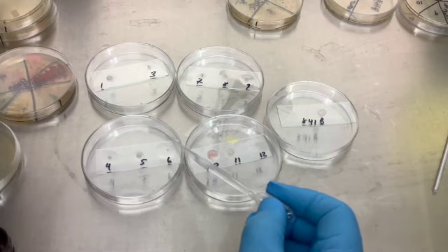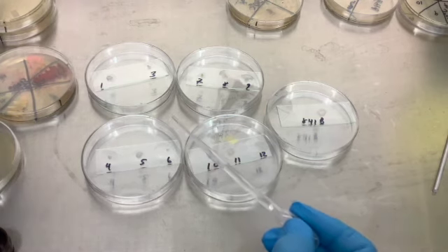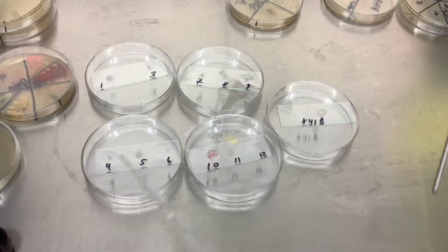Okay, I'm putting a little bit more on number 6, just to verify, because there's not much bubbles, but it is bubbling now. All right, so those are all positive for catalase. Some of them bubble a little more vigorously, some of them just bubble slowly, but the fact that they do have bubbles formed, that means they have the enzyme catalase and it's breaking the peroxides in hydrogen peroxide back into gas form. And so that's a good, quick way to help in identifying bacteria, to do the catalase test.